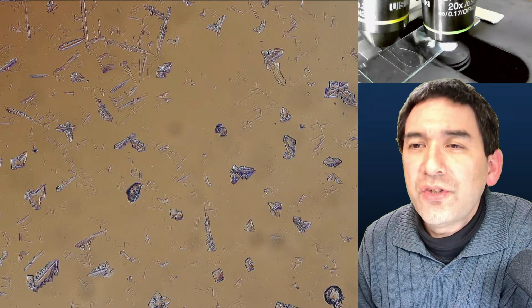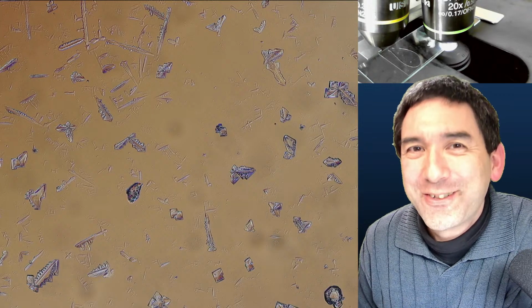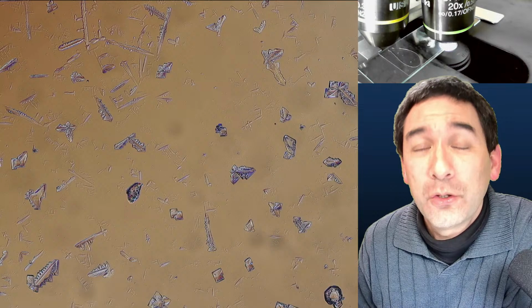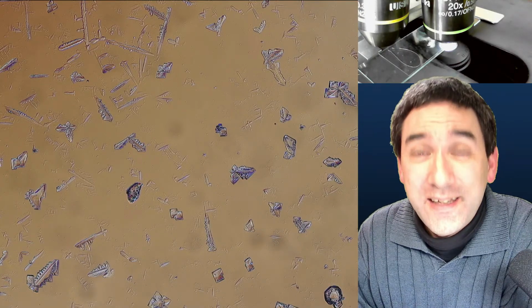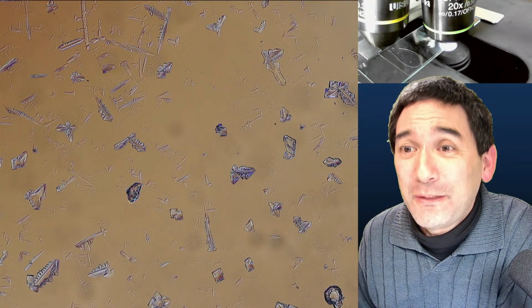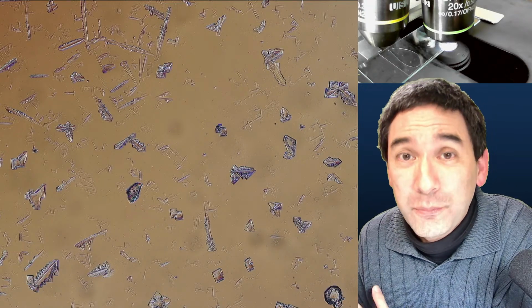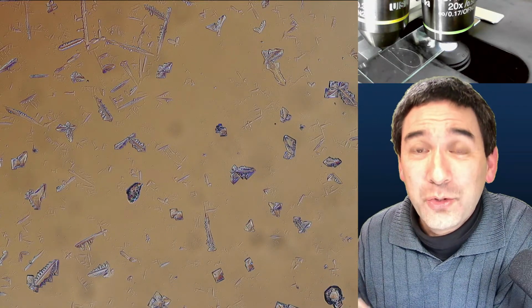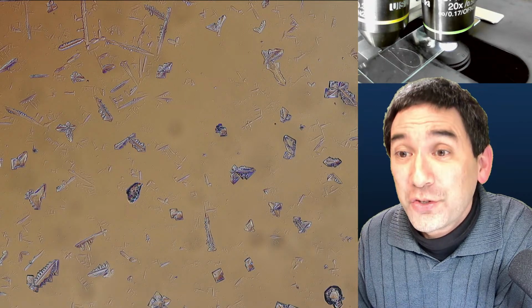There's one question. Are you saying that I could crystallize my own urine? Check my YouTube channel, I actually did that once as well. Yes, you can do that. The crystals actually look quite nice. You put a small drop of your urine on a microscope slide, you spread it, and you allow it to dry. Urine does contain a lot of salts and many different minerals which will crystallize out, and of course also urea, obviously, which we just had a look at. So yes, this does work, and as a matter of fact, I have done that before.